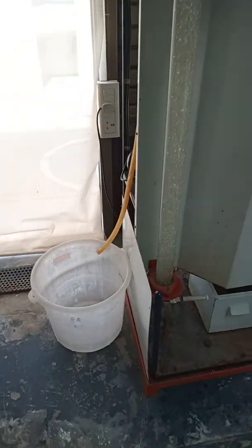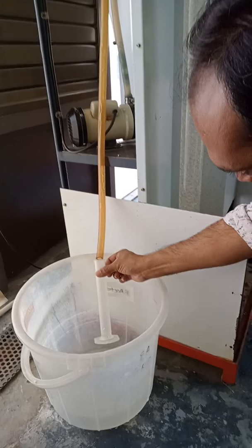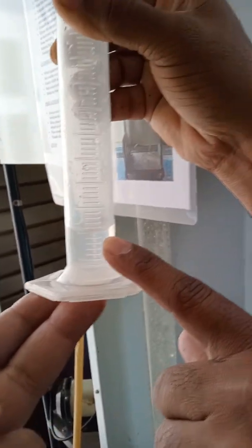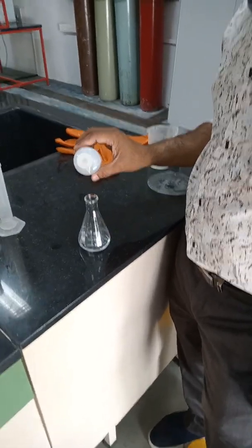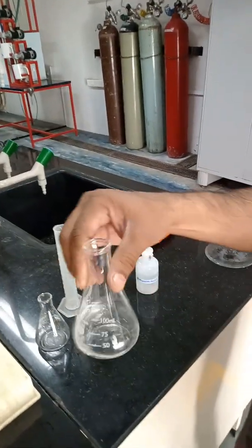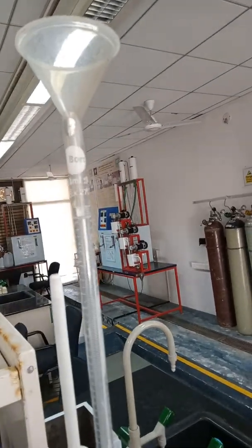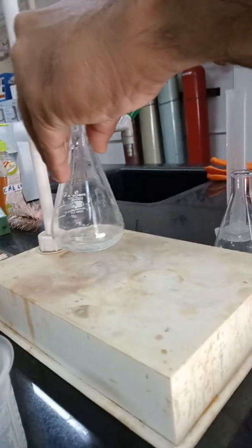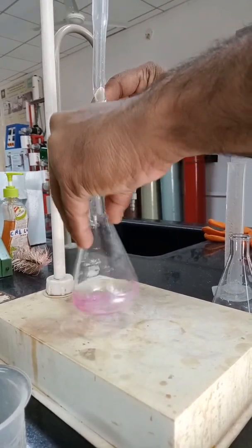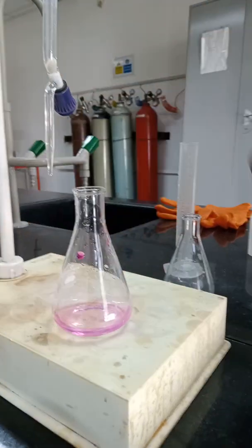Now we are going to start collecting samples. Nearly about 10 ml of sample has been collected and we are going to titrate it. The sample is placed in the conical flask. He is going to add two drops of phenolphthalein indicator, mix it properly, and titrate it against NaOH. We take the initial and final burette readings. Now he is titrating and it is showing some pink coloration — it has turned from colorless to pink.